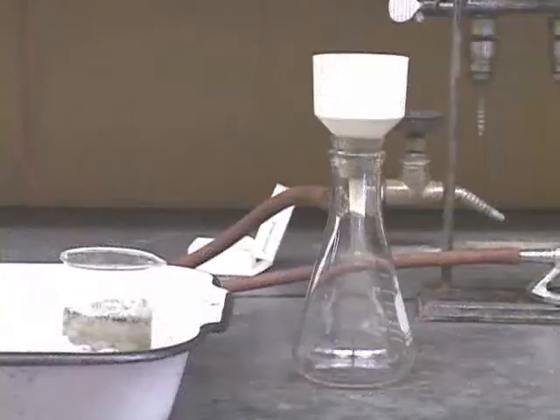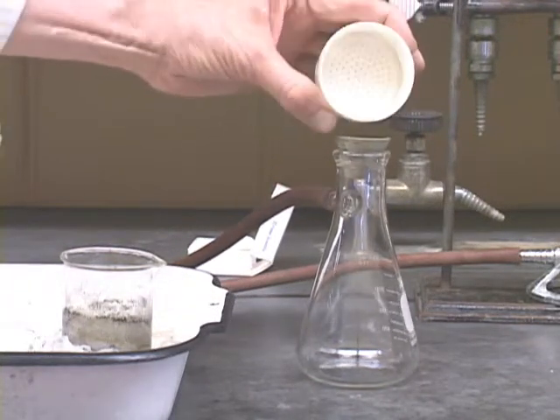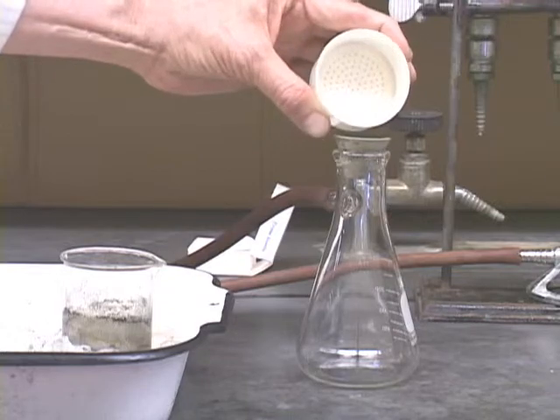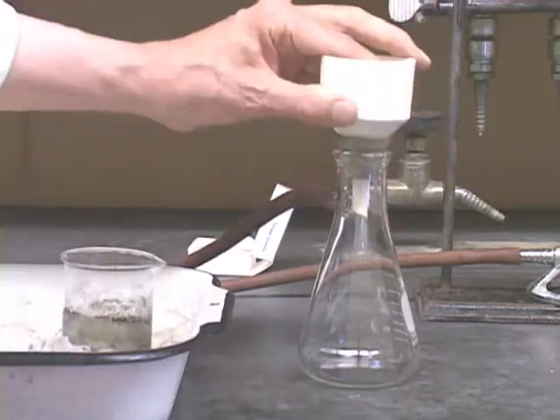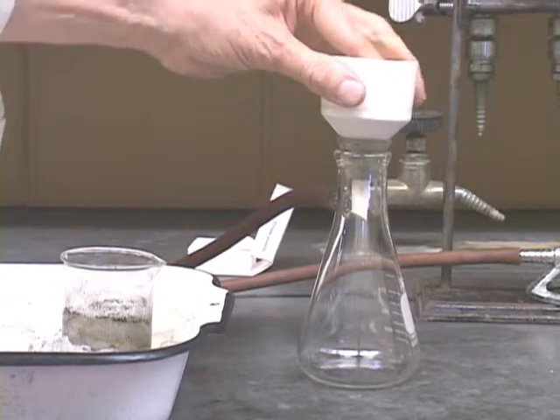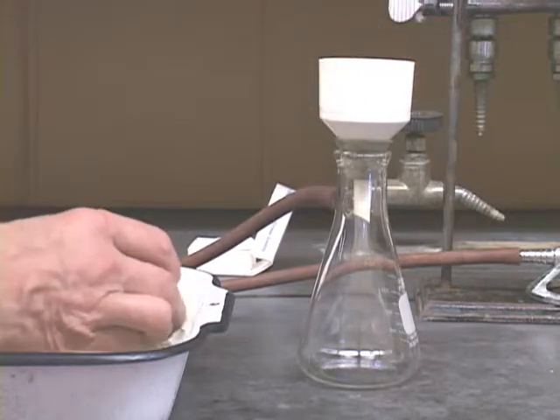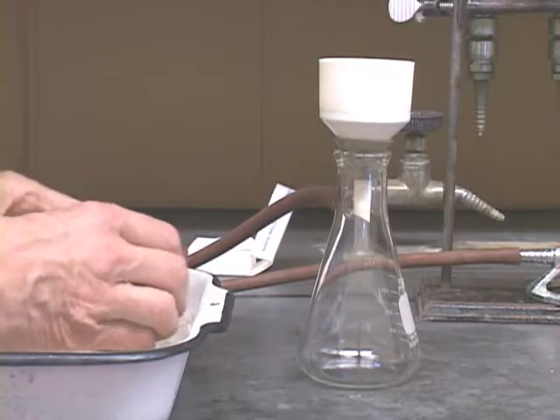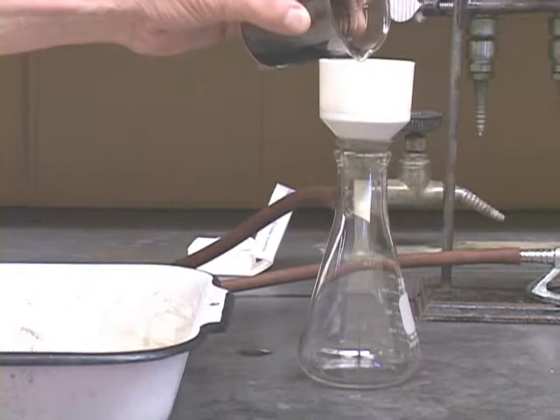When the beaker is cold, you can collect the precipitate, which is the charcoal in the complex, using your Buchner funnel. This has holes in its base, which you must cover with the filter paper. Turn on the vacuum and make sure the filter paper is seated properly. Collect your precipitated reaction mixture.